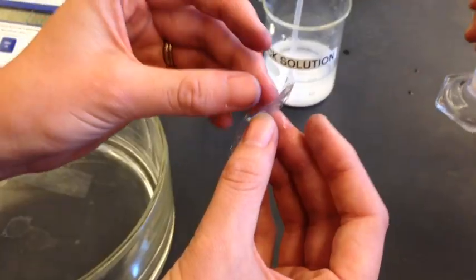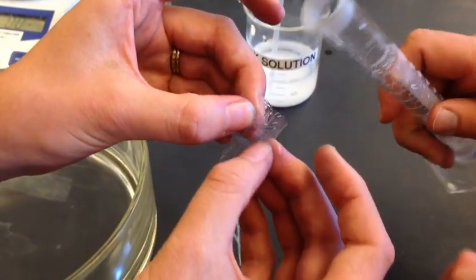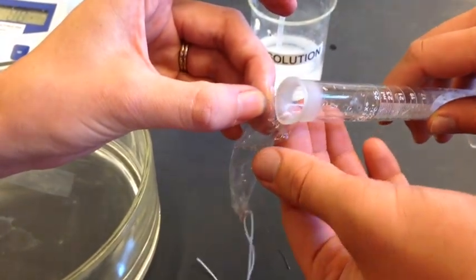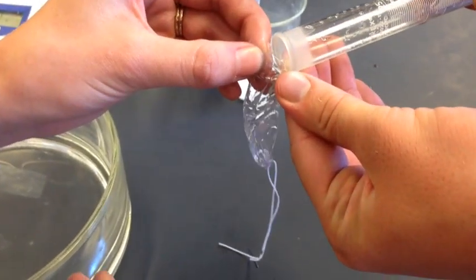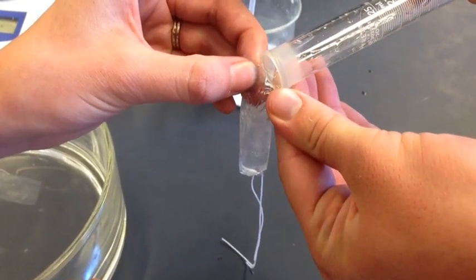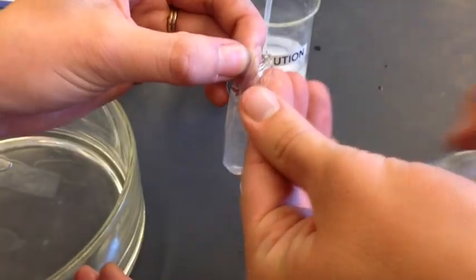Hold one end open—your partner can help with that—and then pour those 10 milliliters of the stock solution into your dialysis bag without pouring any out the side.